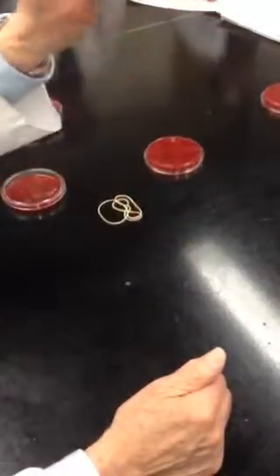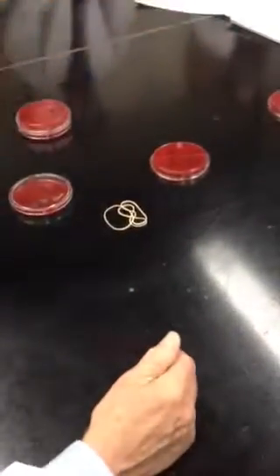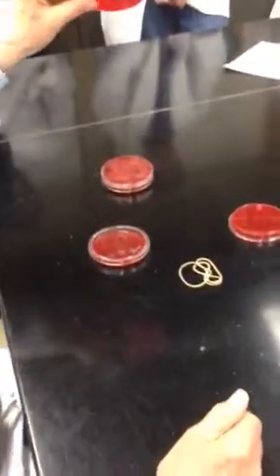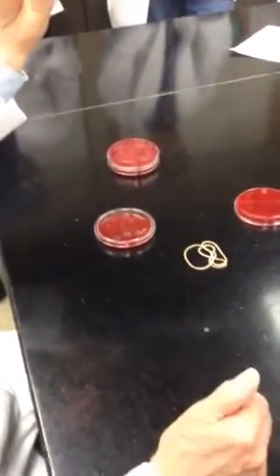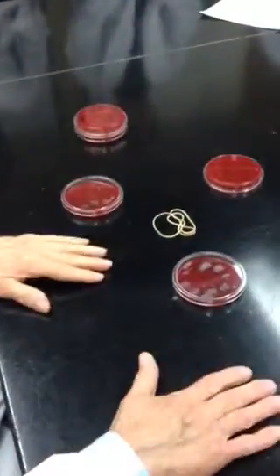This is after using a surgical scrub. Take a look at that damn thing. Why is that happening? Well, this wasn't a proper surgical scrub. It would be reduced if it were done properly. But let's explain all this stuff.